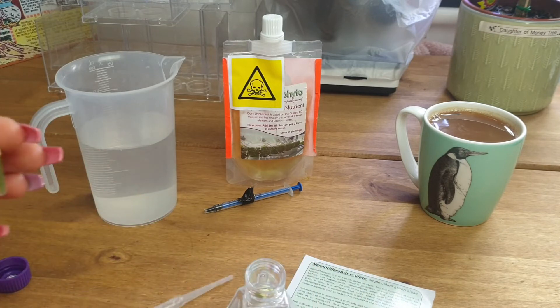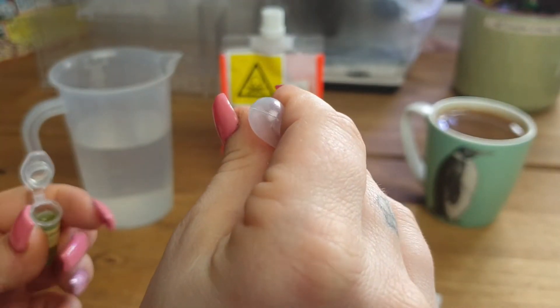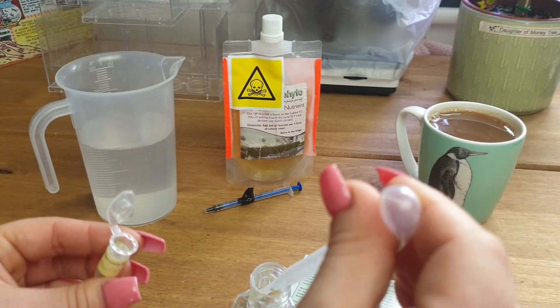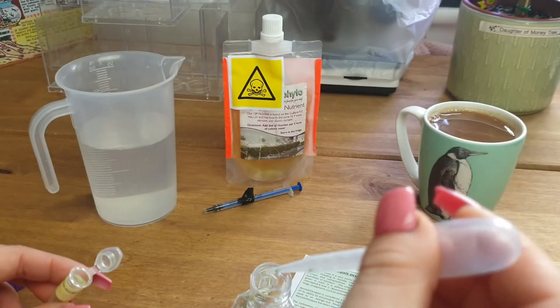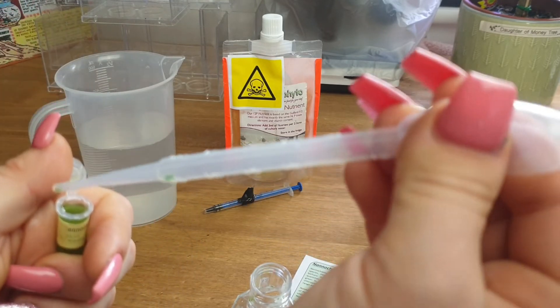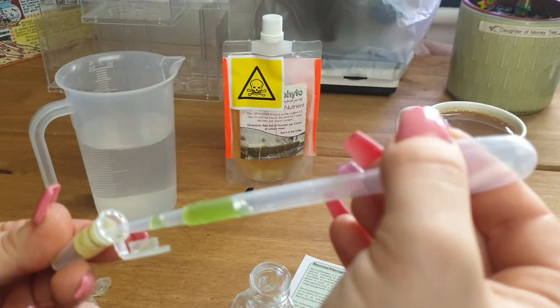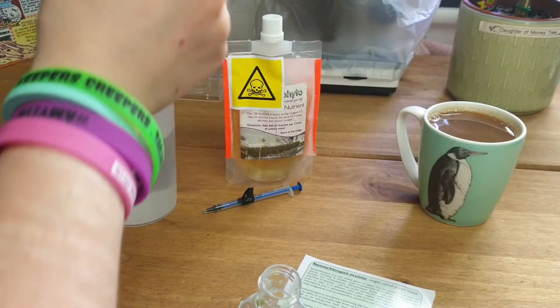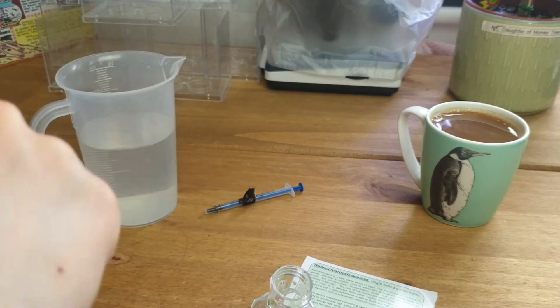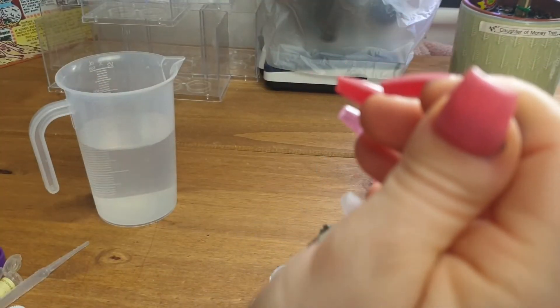So I'm going to go ahead and get started. We'll take our clean culture flask, unscrew the lid, take our first culture vial — I do love that pop sound — and take the pipette. We're just going to pop that in there, suck all of that up, and make sure we get all of this out.